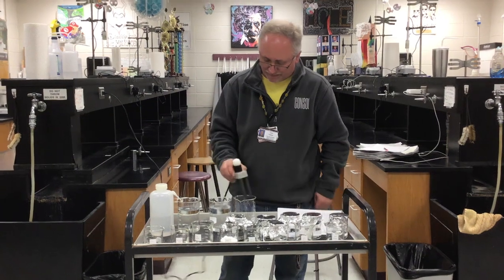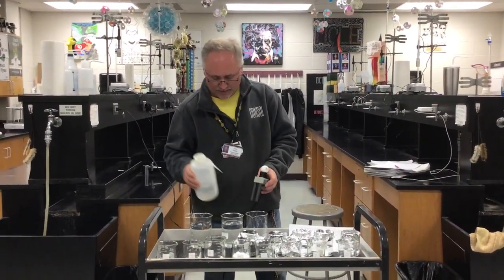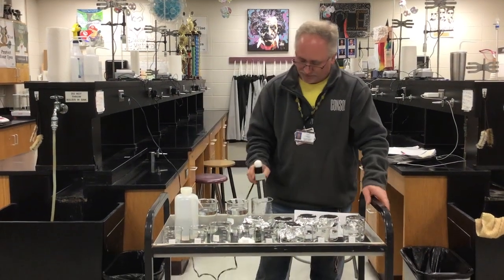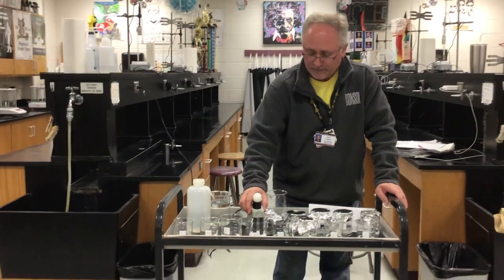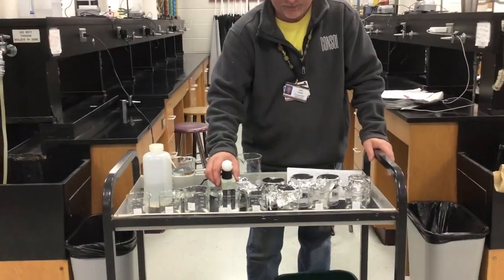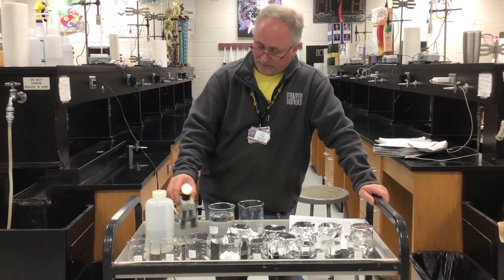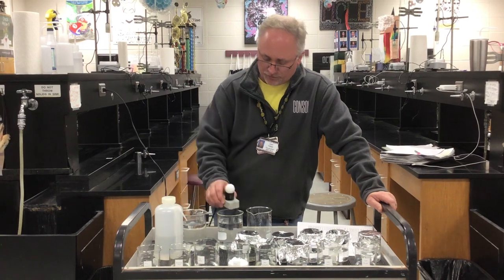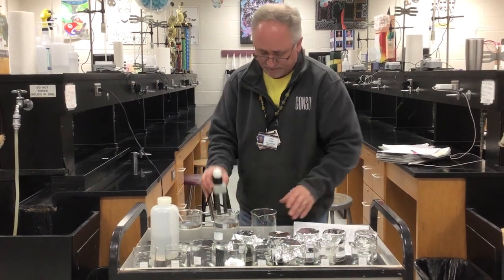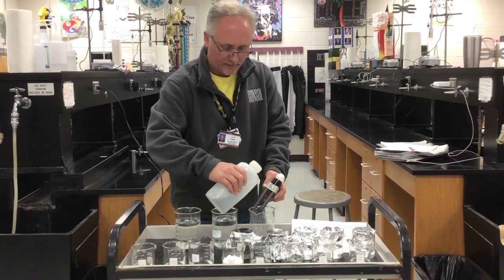The next one is solid sodium chloride, so this is salt as a solid, and if I place the probe in the solid salt, you don't see anything. These ions are not free to move. This is not a solution, it's not dissolved in water. You'll see it light up a little bit over here as I start to dissolve those ions, but you really shouldn't see anything with a solid. So that should be written as a non-electrolyte when it's a solid.